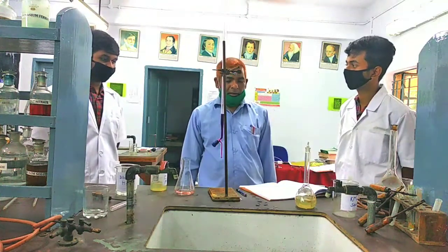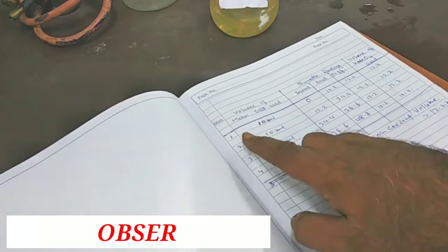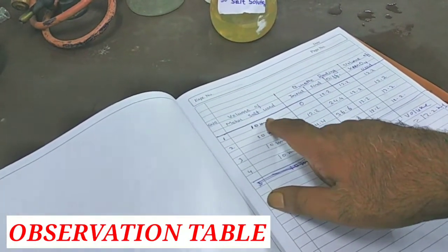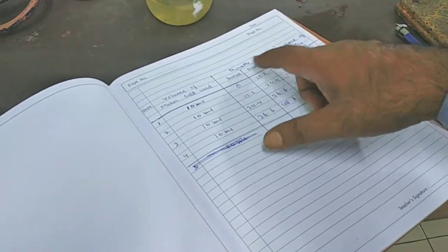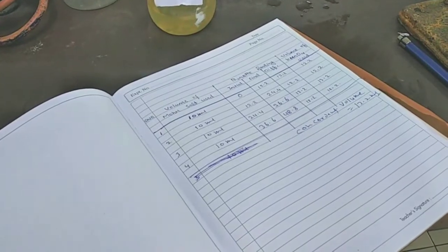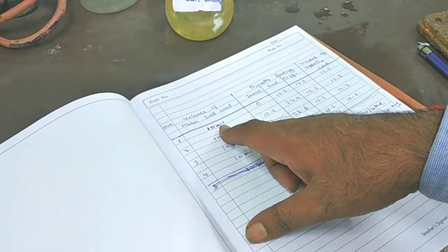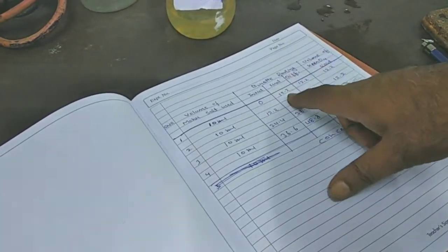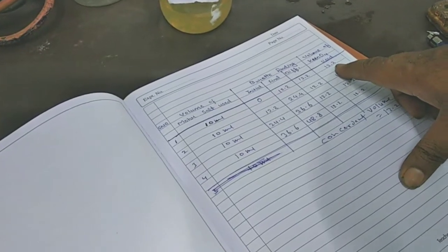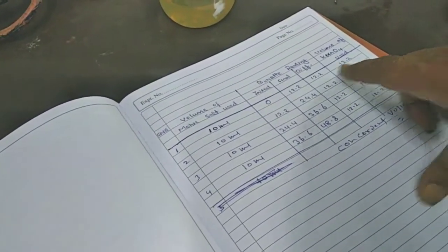Okay, now coming to the calculation. See the observation. In serial number I have written 1, volume of Mohr salt used, burette reading, initial reading, final reading, difference, volume of KMnO4 solution used. In serial number 1, volume of Mohr salt used is 10 ml, initial 0, final 12.2, difference 12.2, and 12.2 is KMnO4 used to oxidize Mohr salt.